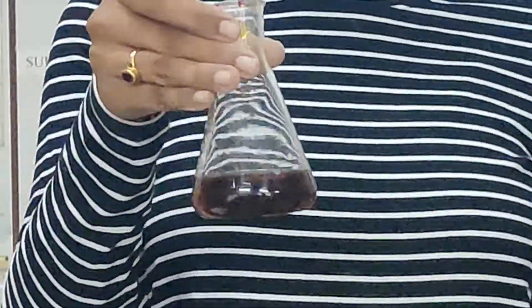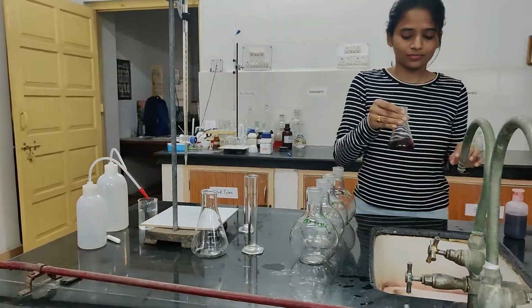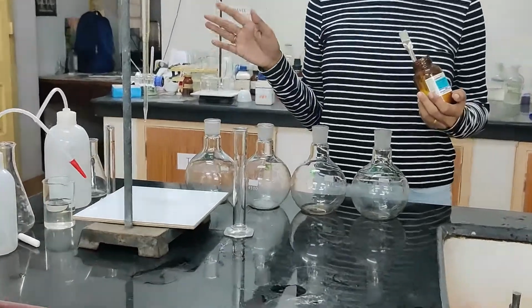So again we need to perform this thrice to get an average reading. Okay, so we are done with the standardization.